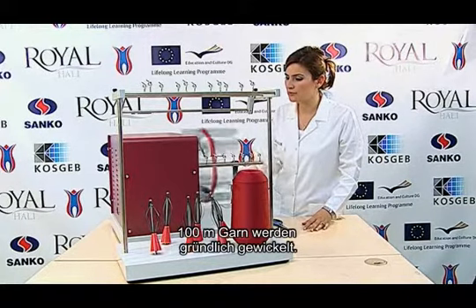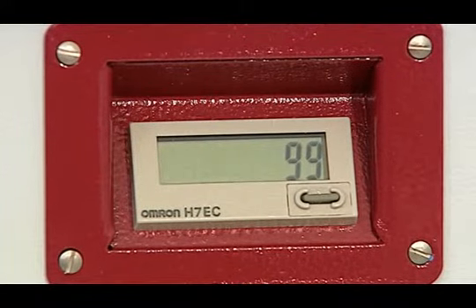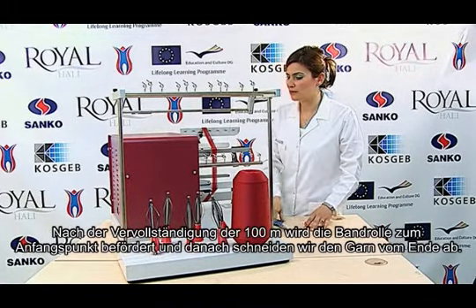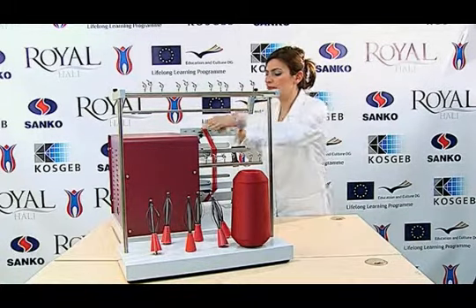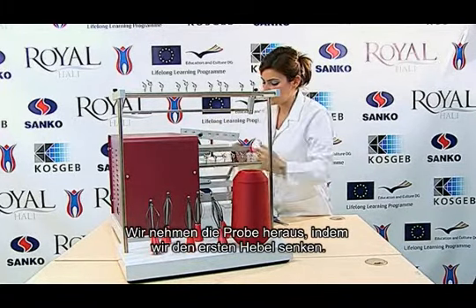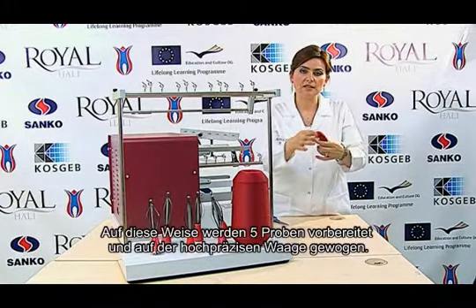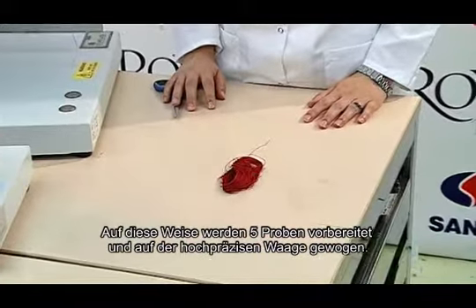100 meters of yarn are wound properly. After completing 100 meters, the reels are taken to the starting point and then we cut the yarn from the end. By lowering the first handle, we take our sample out. 5 samples are prepared in this manner and then weighed on the precise balance.